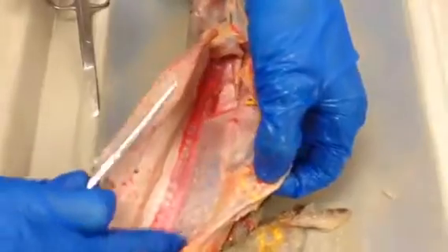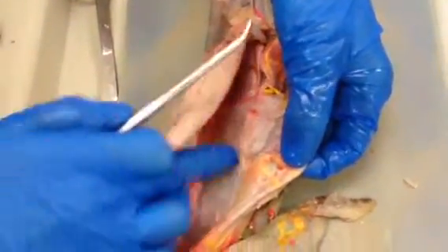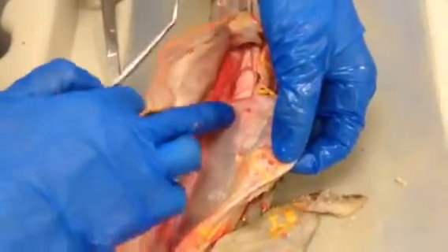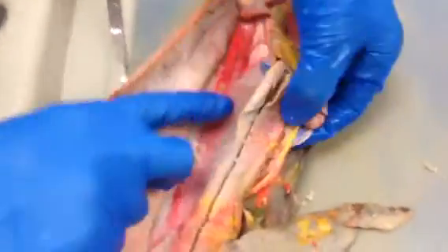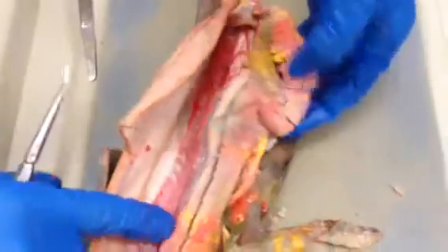Okay, the mesentery that attaches to the stomach and small intestines is called the greater omentum. So this big sheet is greater omentum. This little part here that splits into the two between the stomach and liver comprises the lesser omentum. So lesser omentum here, greater omentum here.